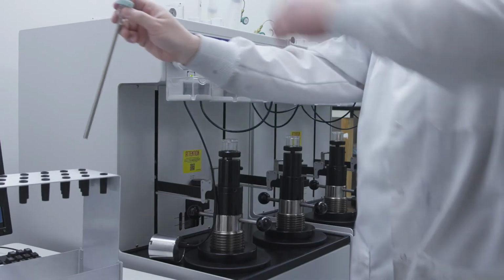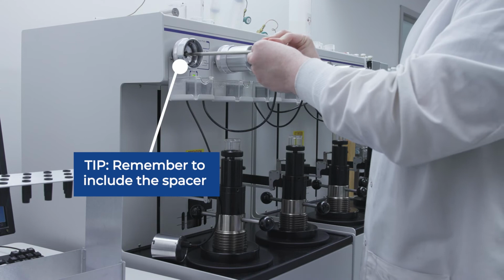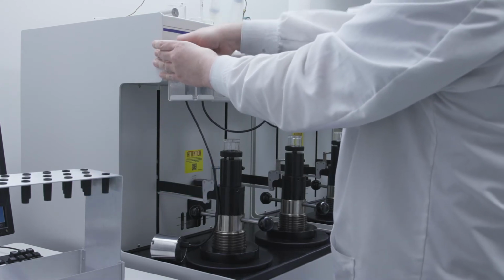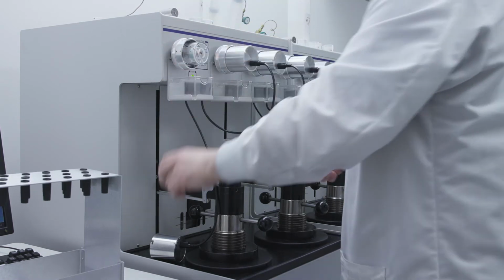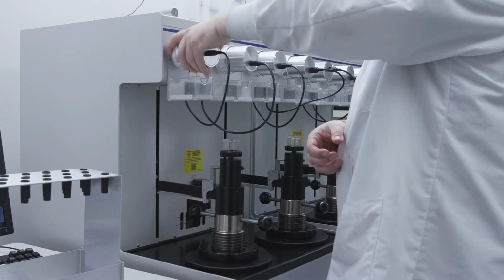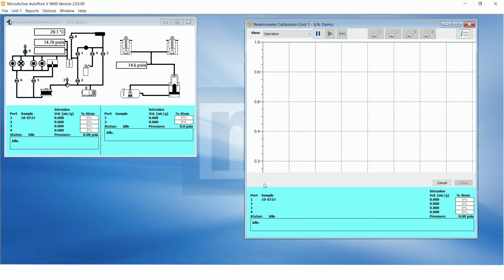We need to install the sealed penetrometer into the low pressure port just as we did earlier when we analyzed the sample, remembering to include the spacer to properly align the penetrometer and the transparent retainer. Once the port is sealed and the detector assembly is in place, we can move back to the computer. We click Fill on the calibration wizard. The penetrometer will be evacuated and filled with mercury.